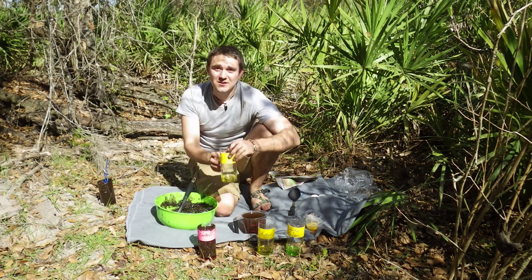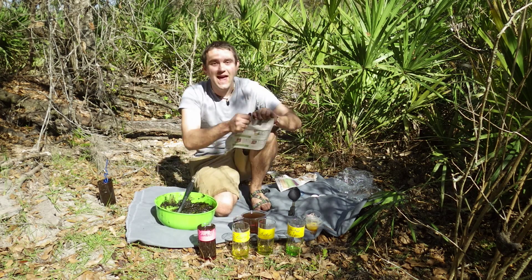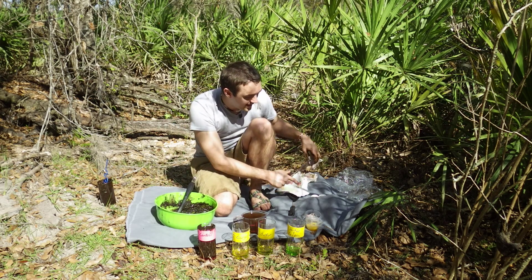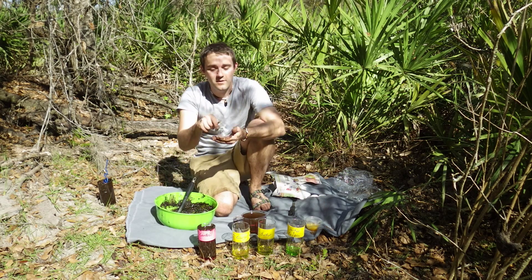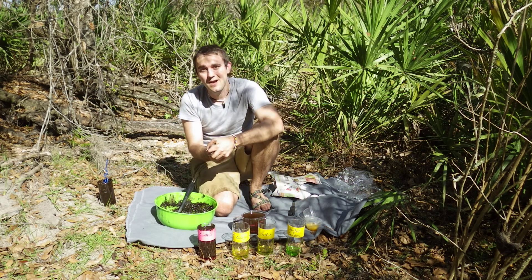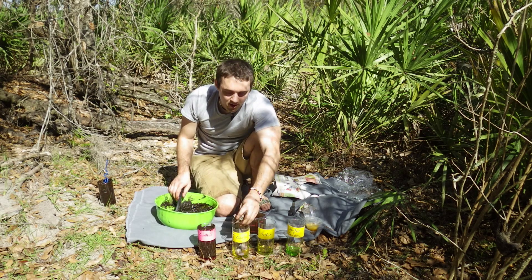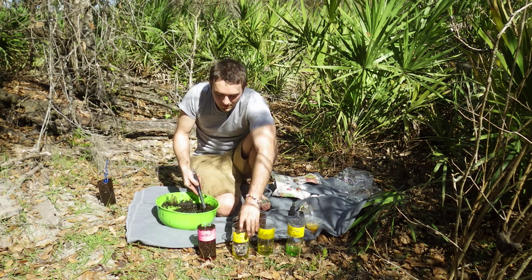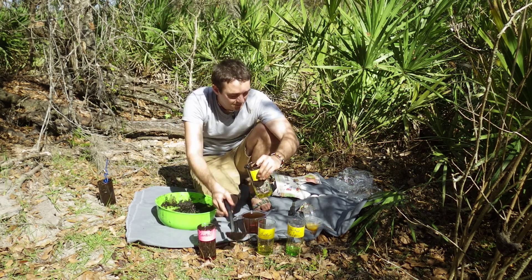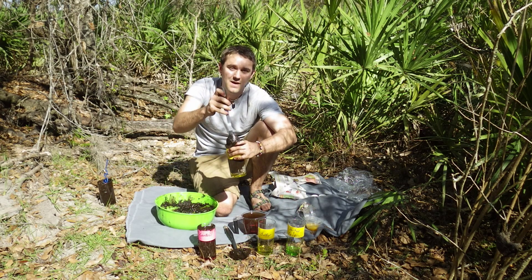The second column is going to be the carbon column. In order to add carbon, all you need is old paper. Here we have an old ad that we'll rip up into tiny pieces and add to the column, or you can add already moistened paper. Either one will work fine as it's going to get moist when we add the mud and the water. This is mixed with the mud going into the column. I've added the carbon source and now I'm adding the mud, and I'll simply mix these two ingredients together to grow the microbes inside.